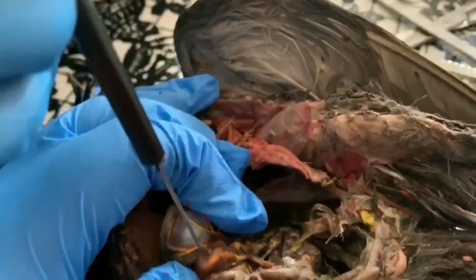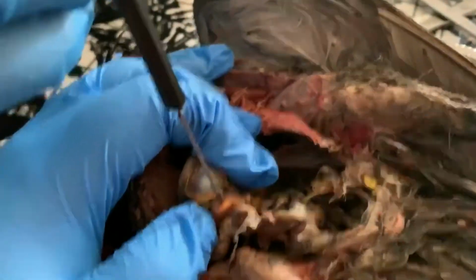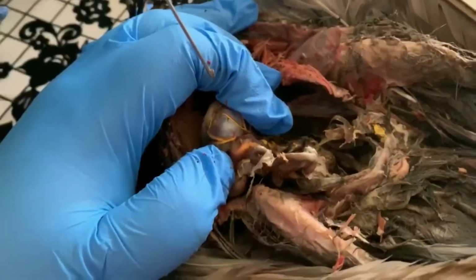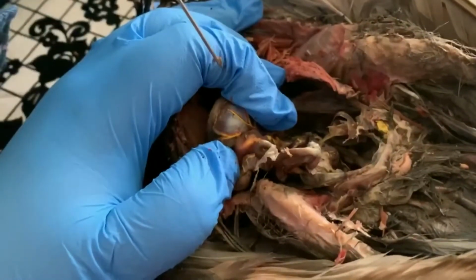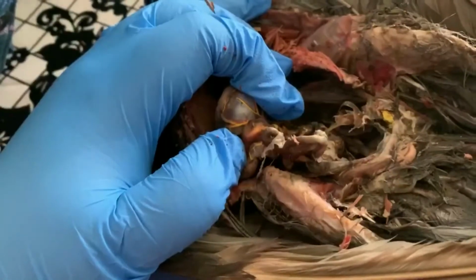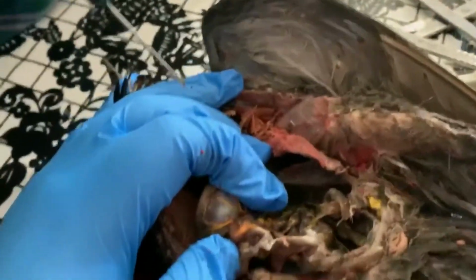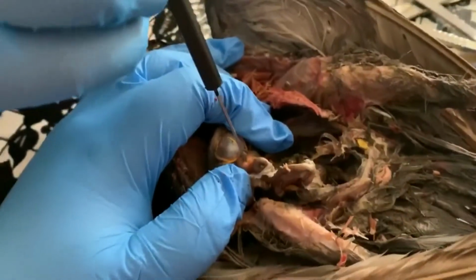As you approach the terminal end, there's some bacterial decomposition that happens in the ceca. So for anything that is living predominantly on plants, and birds qualify when they're seed eaters like pigeons, we're talking about having some area of the gut where bacteria live and are able to help ferment those plant foods. And yeah, that brings us to the end of our digestive tract.